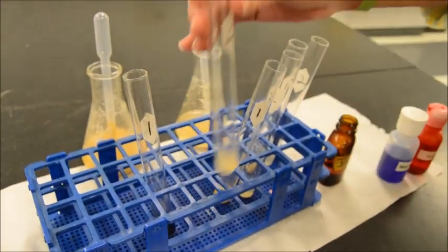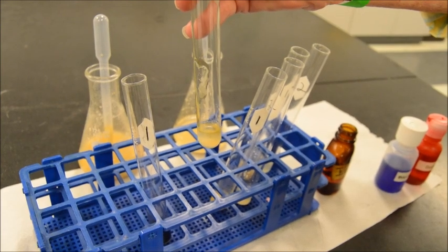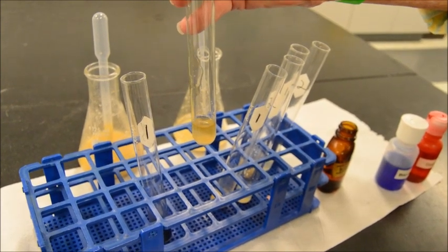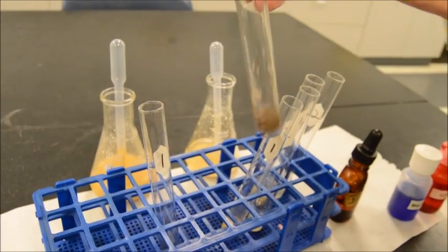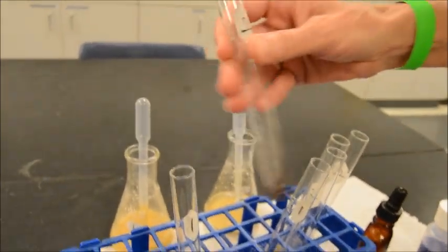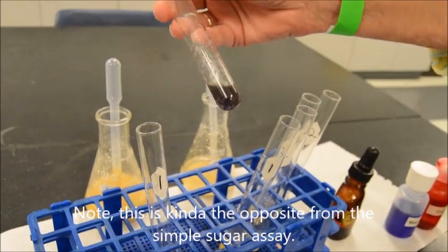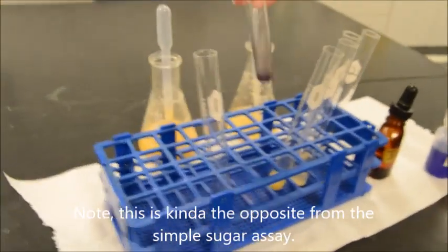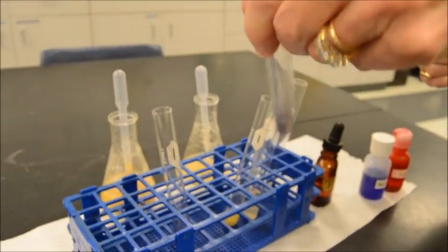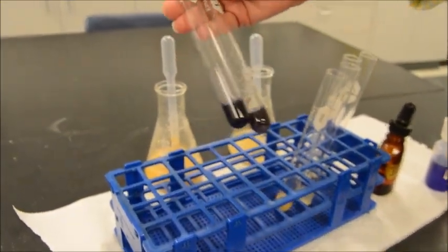All right, here goes our 10 drops. Okay, there's 10. Very telling. Oh, a little bit. So see how mixing becomes important. Wow, look at that. I didn't think that was going to change, really. So, frankly, I would say that probably doesn't contain the amount of starch as does the first. Yeah. So that first one has lots of starch in it.